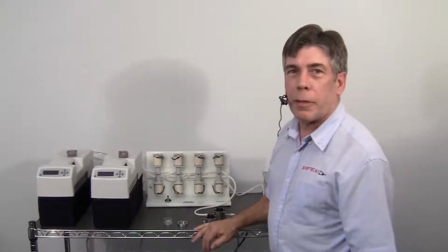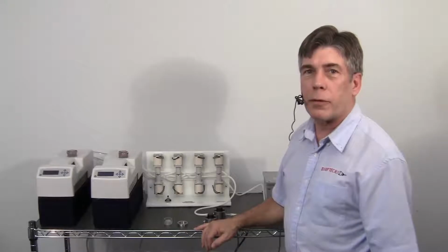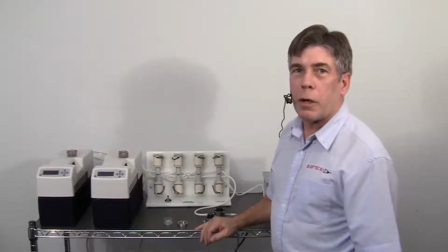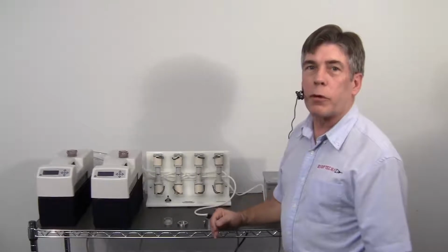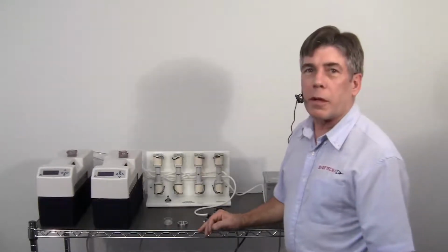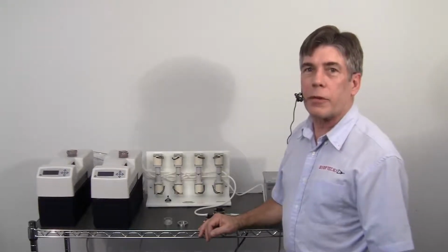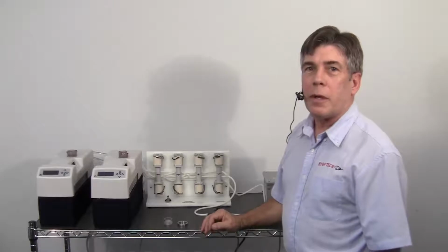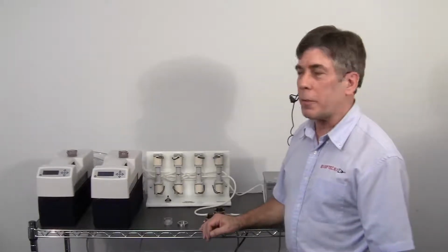I'm the engineer here at Bioptechs, and I'm going to introduce you to a system that we developed here for a customer that needed to observe worm embryos and temperature transitions for those worm embryos on a microscope. The scope they're using is using high numeric aperture objectives, therefore they needed to have a cover slip surface and a very rapid temperature change capability for the specimen at the specimen plane.